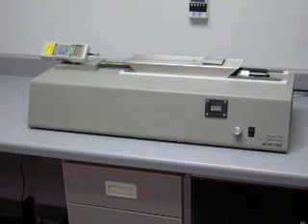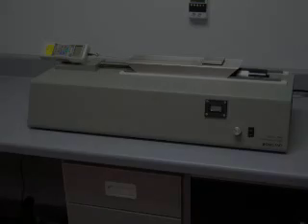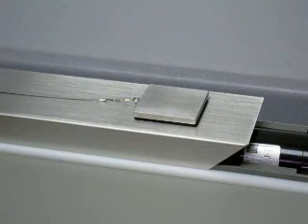The FX7100VSC is a combination tester with the addition of sample grips and a reversible drive to allow peel, seal, and low elongation tensile testing in addition to COF testing. All models come with a 200-gram sled with dimensions of 63.5 millimeter or 2.5-inch square and flexible cable with weight and foam density specifications certified to meet the requirements of the standards. Our model FX7200 quality control software records, graphs data, calculates COF values, and provides reports for quality control record keeping.